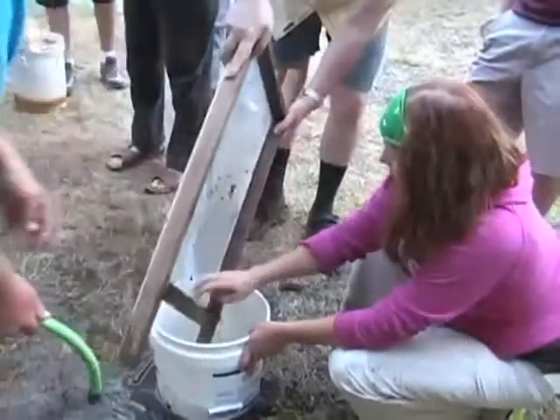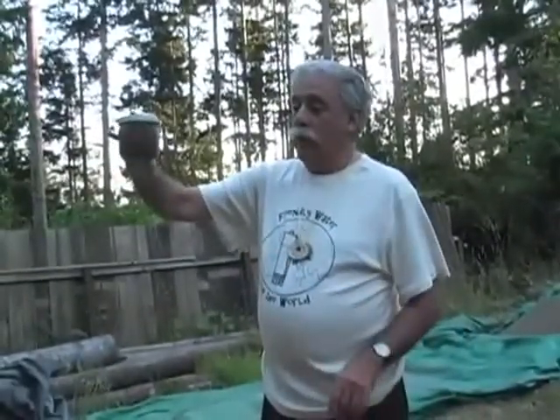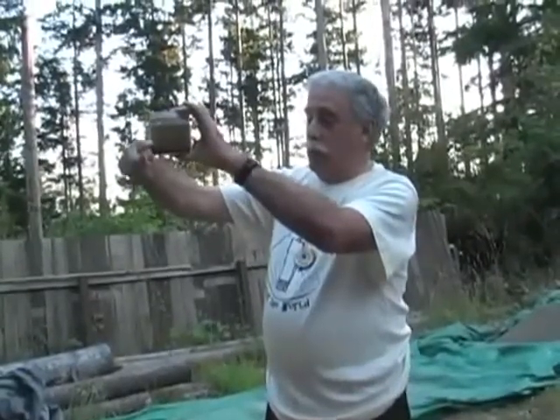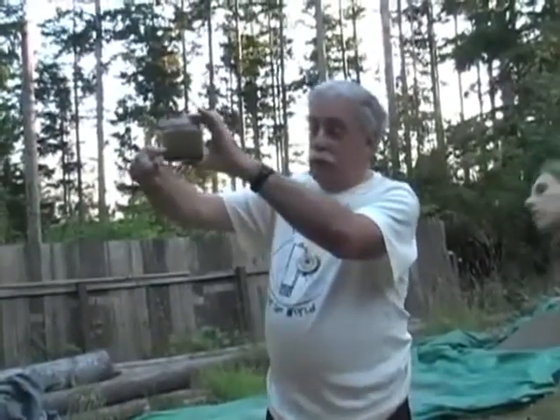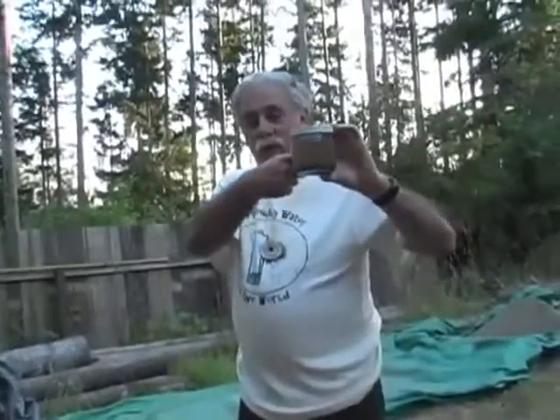Can you give me a little water in the sand jar? I'm going to do a little demonstration. Okay. It should be relatively clean. And how clean? Basically, you go like this, and then you go 1, 2, 3, 4, 5. And if you can see your finger through it, it's clean enough. It doesn't have to be clear, but you do have to be able to see your finger. Can you put your finger on the other side, so we can see? You can't. No.